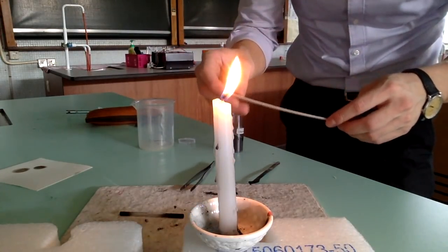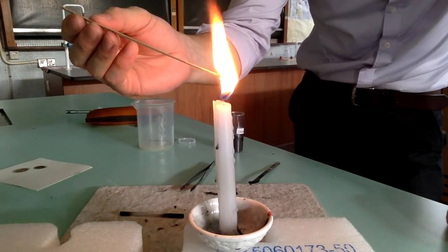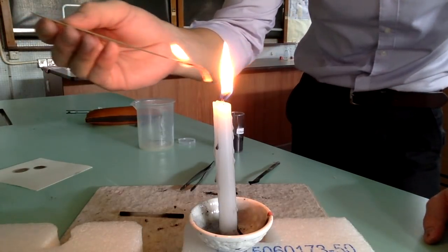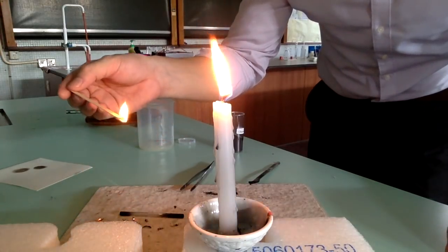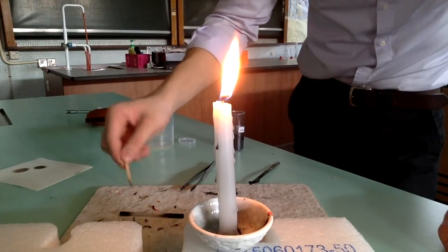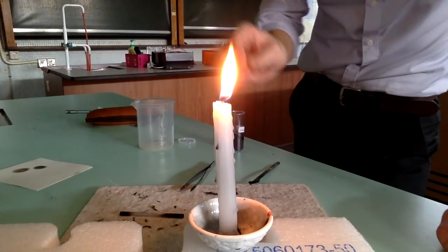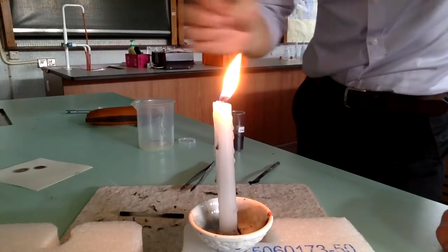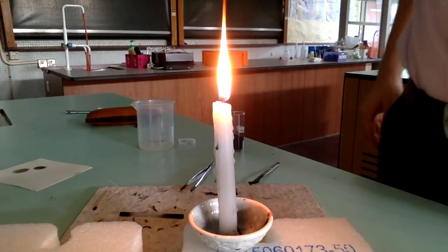For the last part of the experiment, we try to relight the candle without the flame touching the wick. I light up a wooden splint as the burning splint, then quickly blow off the candle and put the splint next to the wick — but not touching it. The candle relights without the flame touching the wick. If you notice, when I place the burning splint next to the candle, the flame transfers to the wick and relights — it seems like I burned something lingering in the air. Think about what that might be.